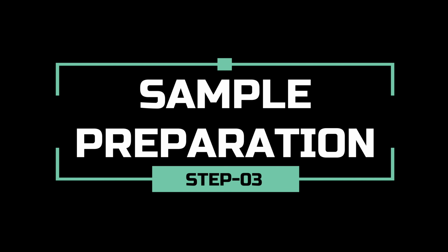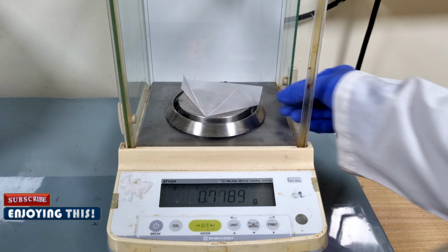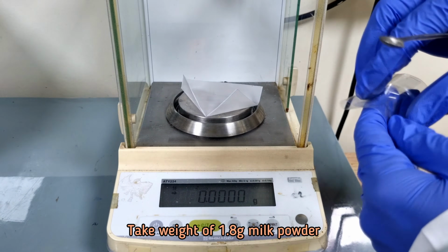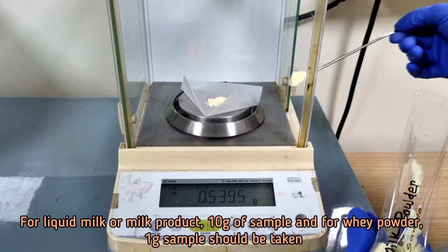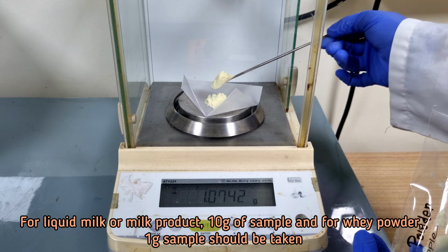Now we are going to prepare our sample. In the case of milk powder sample, take weight of 1.8 grams milk powder. For liquid milk or milk product, 10 grams of sample, and for whey powder, 1 gram sample should be taken.